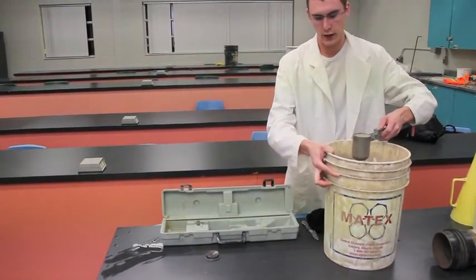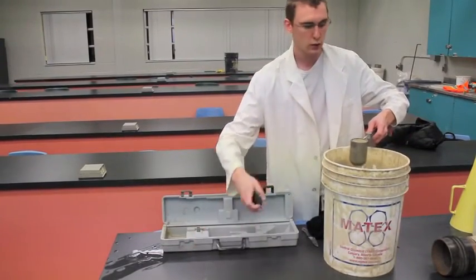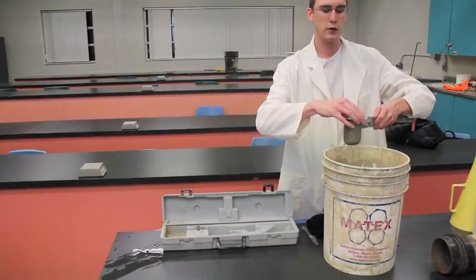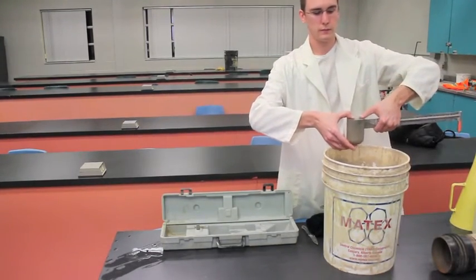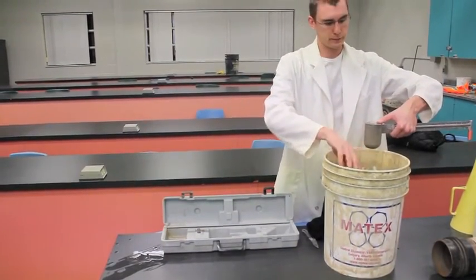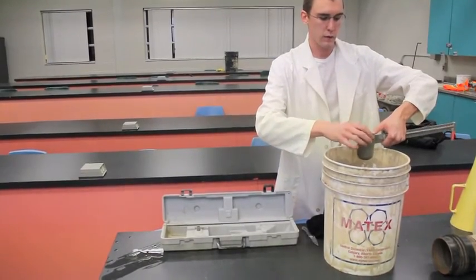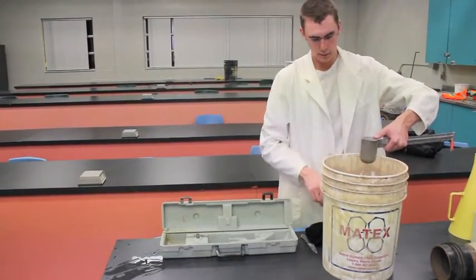With this test it's important that when putting the cap on you make sure you have some excess mud run off the top. There we go, we have some coming out of the top. Now this will let us, this will give us an exact amount inside the cup.